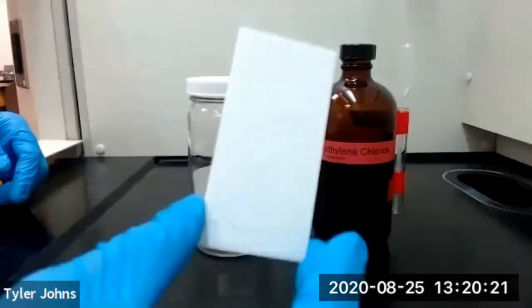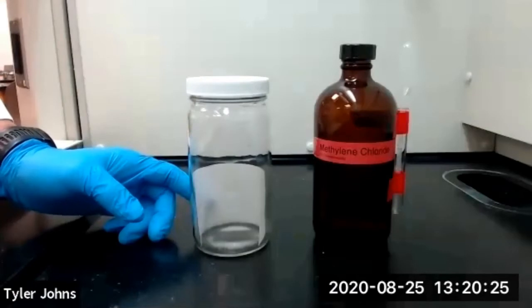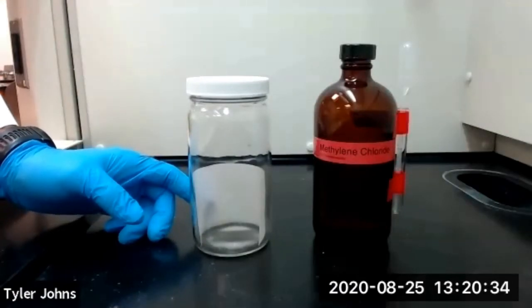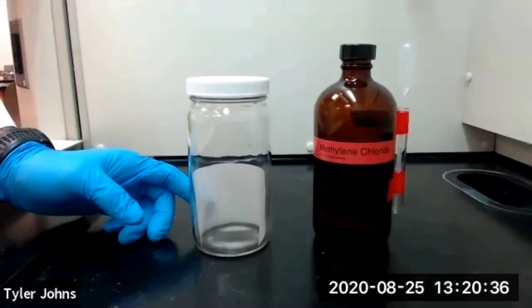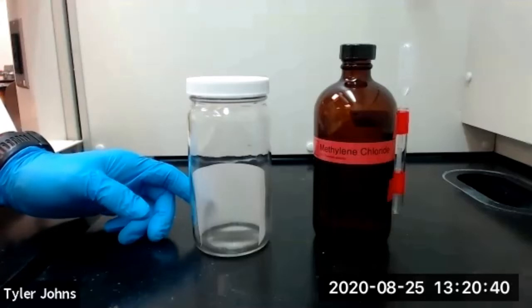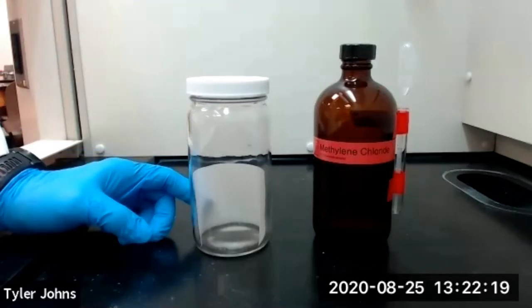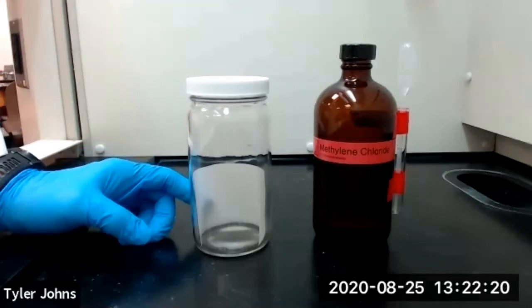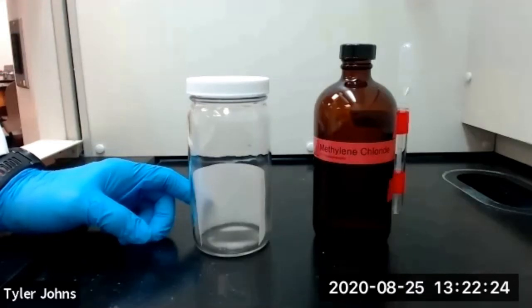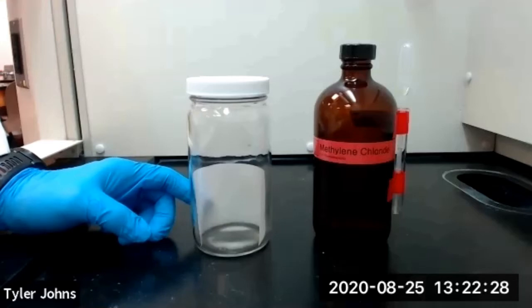We'll then place our TLC plate inside the development chamber and allow the TLC plate to develop. We'll remove the TLC plate once the solvent front is within one to two centimeters of the top of the TLC plate. You need to remember to mark the position of the solvent front on the TLC plate as soon as you remove it from the development chamber, so that you can calculate your RF values.